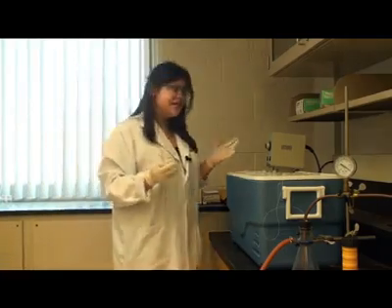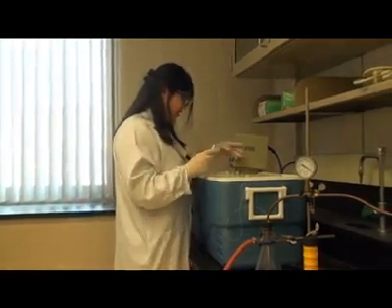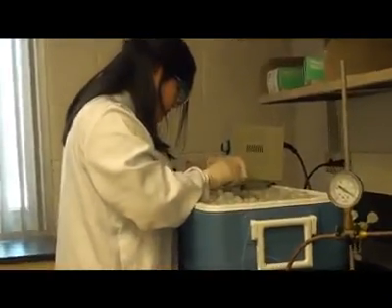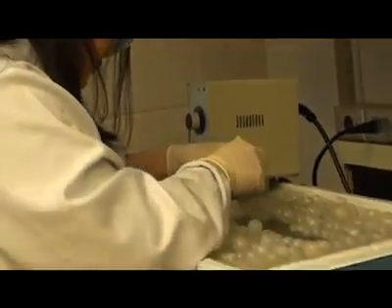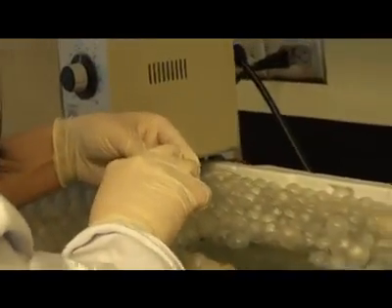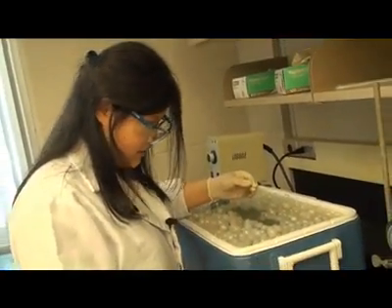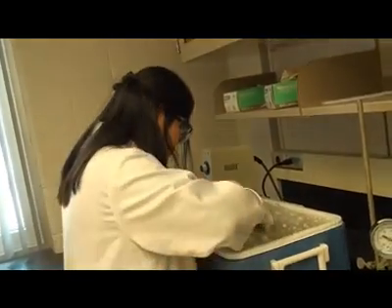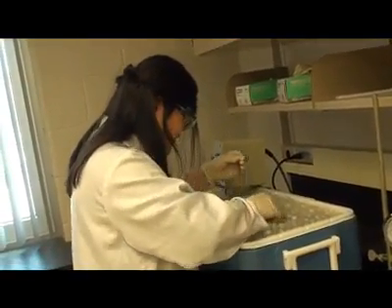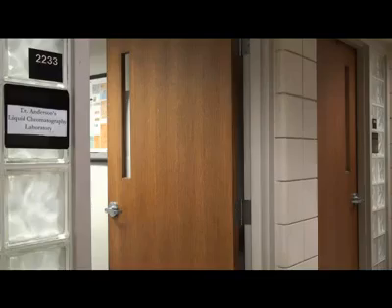Now my column has finished coating and now you want to cut off from the sealed end first. And you want to carefully remove it from the water bath. Now we can take our column and take it to the GC lab where it will be conditioned.